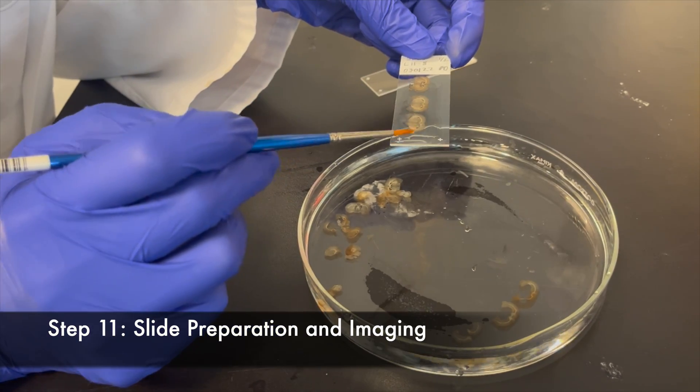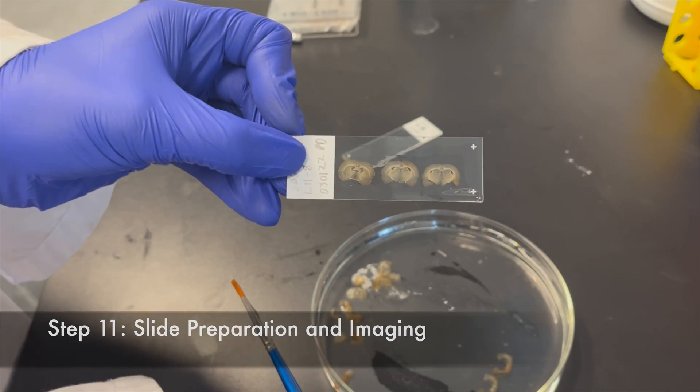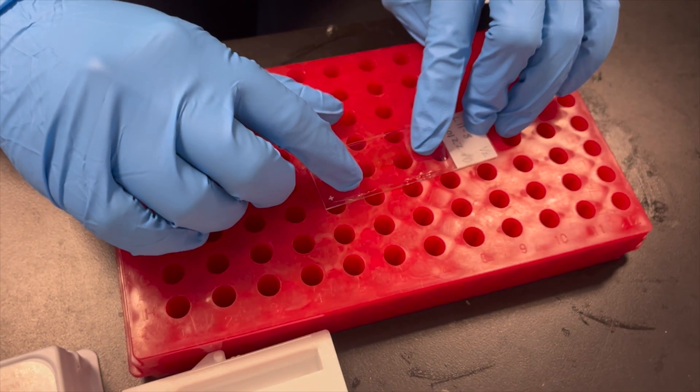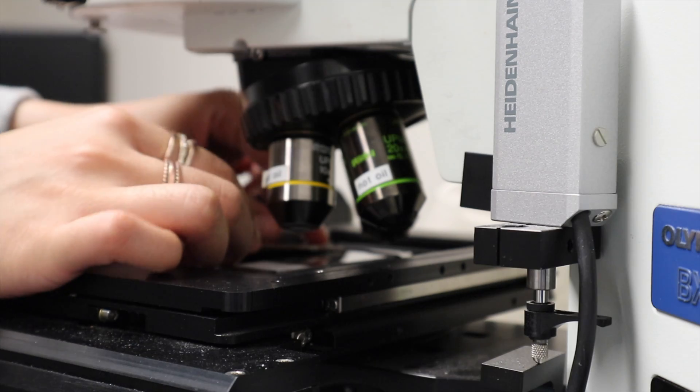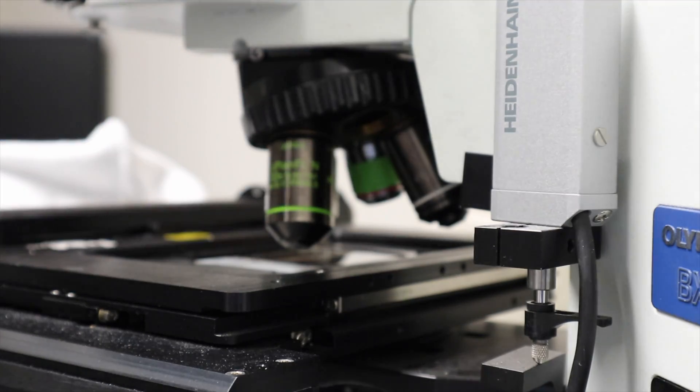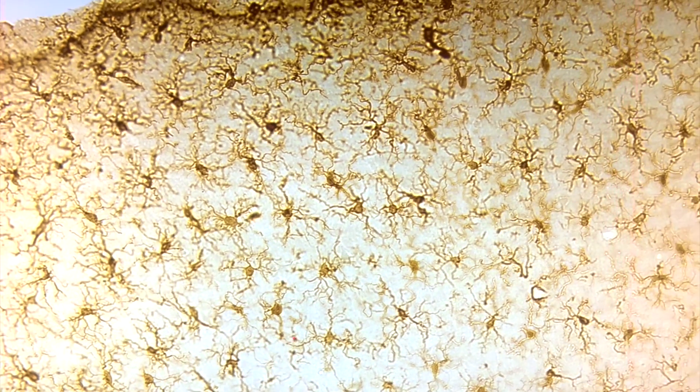If the stain is performed correctly, your tissue should now be ready to be mounted, cover-slipped, and imaged. We hope you have a gleeful time visualizing your microglia. Thank you.